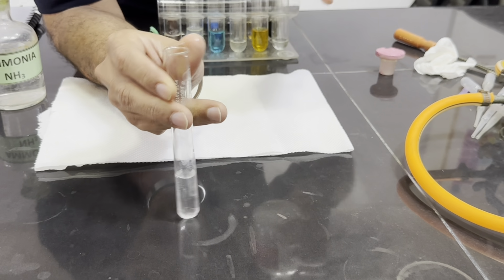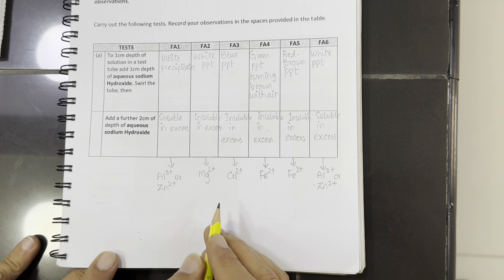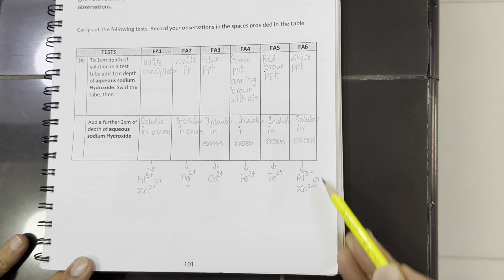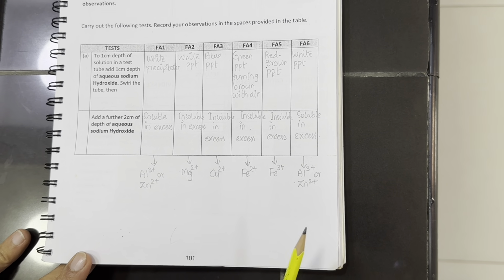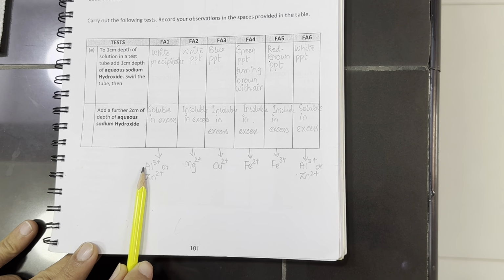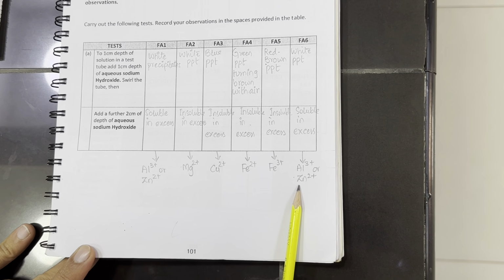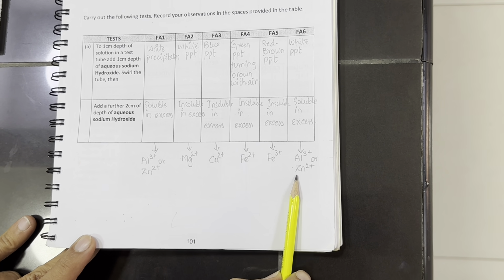Yes, so the white precipitates in few drops dissolved in excess. Now, with the sixth solution, I got white precipitates which were quickly soluble, dissolving. So it can be Al3+ or Zn2+. Now, if we are confused with the test of cation, that it could be Al3+ or Zn2+, we normally proceed with another test for confirmation, and that is with aqueous ammonia.